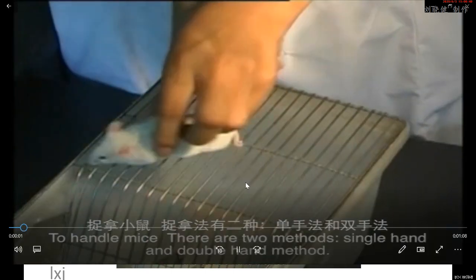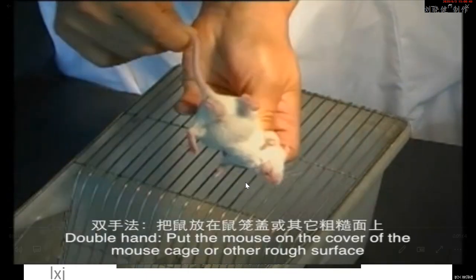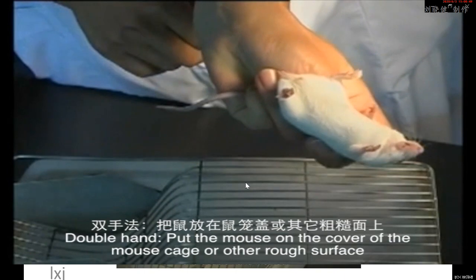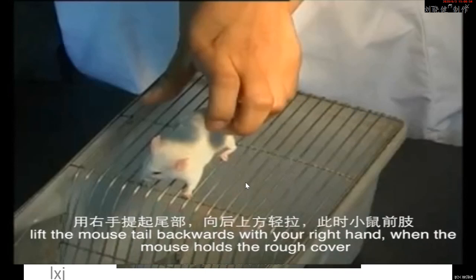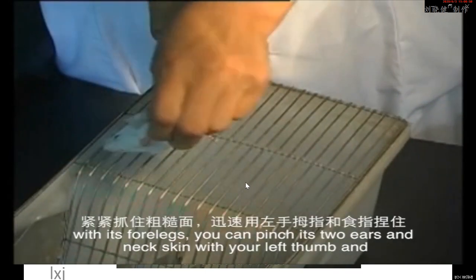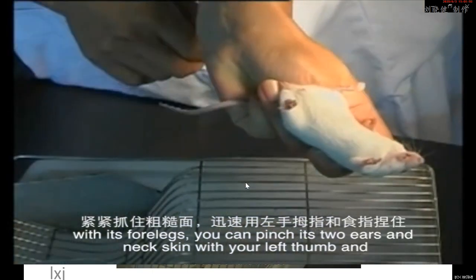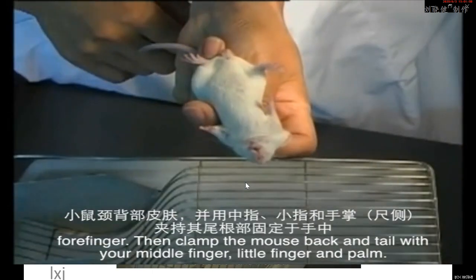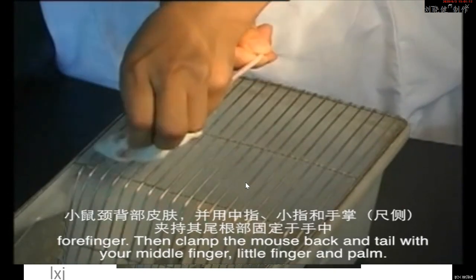There are 2 methods, single hand and double hand method. Double hand. Put the mouse on the cover of the mouse cage or other rough surface. Lift the mouse tail backwards with your right hand. When the mouse holds the rough cover with its forelegs, you can pinch its 2 ears and neck skin with your left thumb and forefinger, and then clamp the mouse back and tail with your middle finger, little finger, and palm.